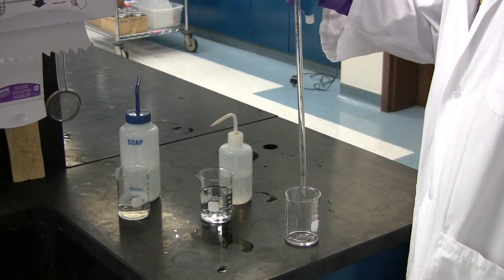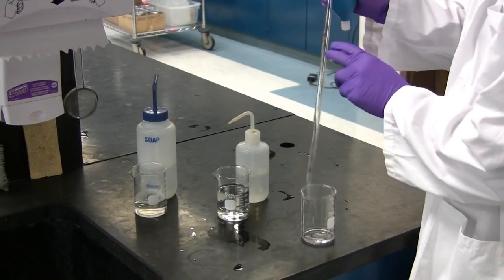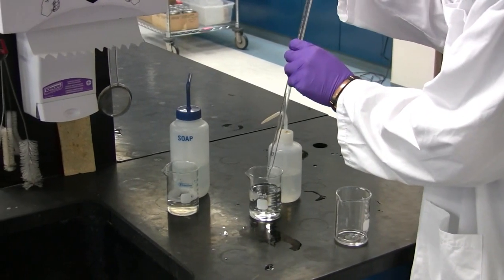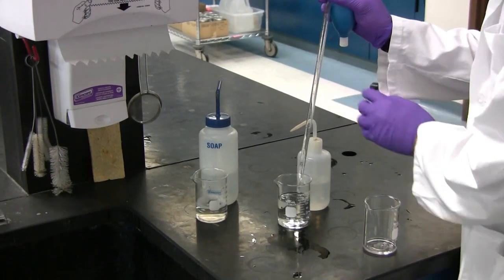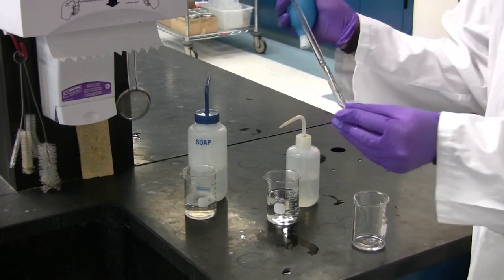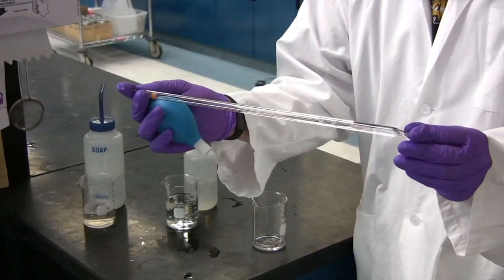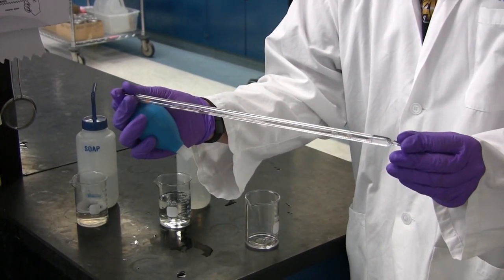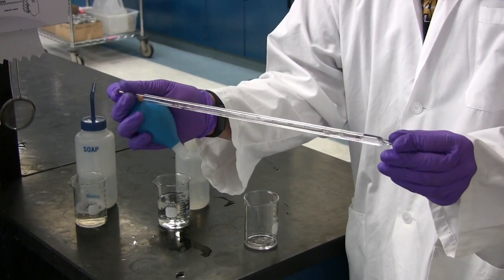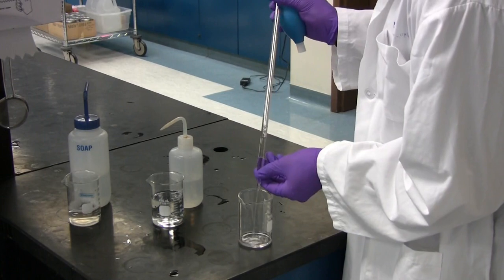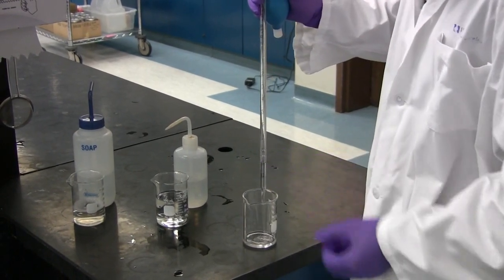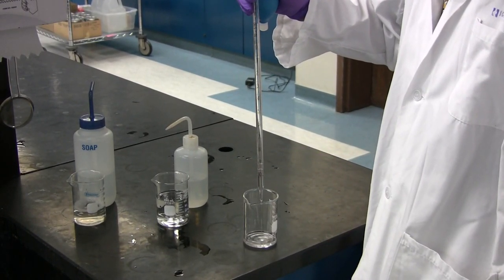Once finished, you need to start by withdrawing some tap water inside of it and repeating the exact same procedure. Tilt it back and forth to ensure coating the pipette and rotating it towards yourself to coat all sides without spilling any liquid. This will be deposited into the exact same waste beaker. Repeat this procedure six to seven times.